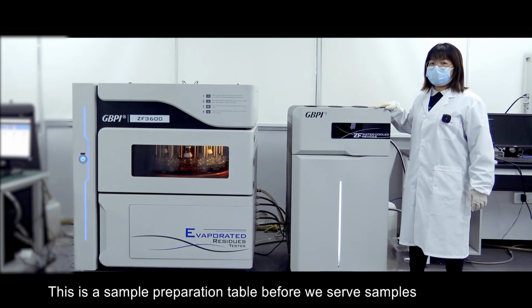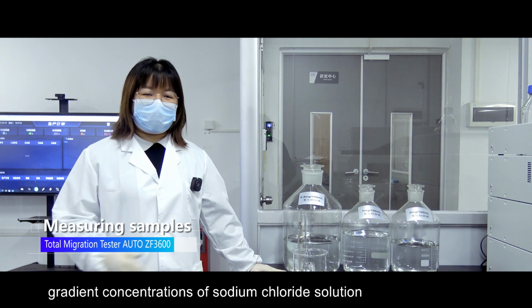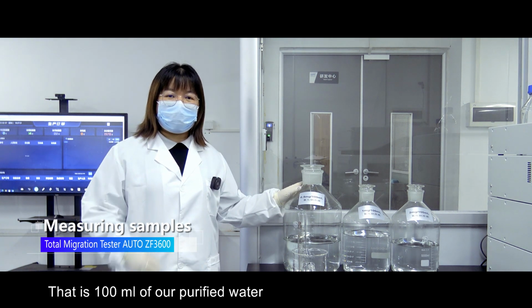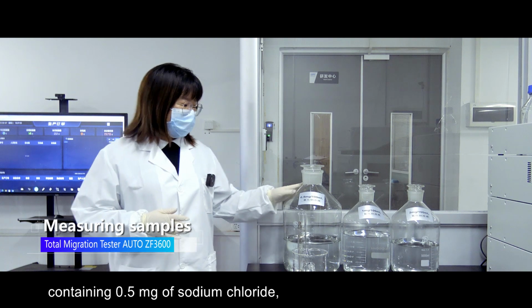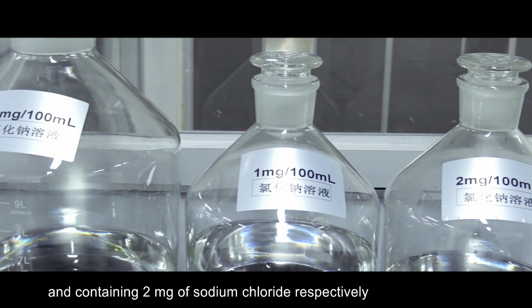This is a sample preparation table before we serve samples. We now prepare 3 different gradient concentrations of sodium chloride solution to verify the accuracy of our Auto ZF3600. That is 100 milliliters of our purified water containing 0.5 milligrams of sodium chloride, 1 milligram of sodium chloride, and 2 milligrams of sodium chloride respectively.